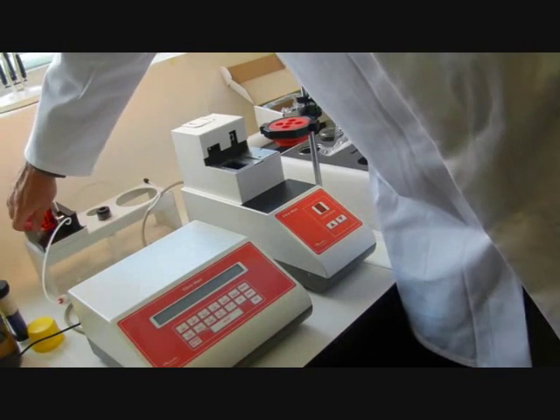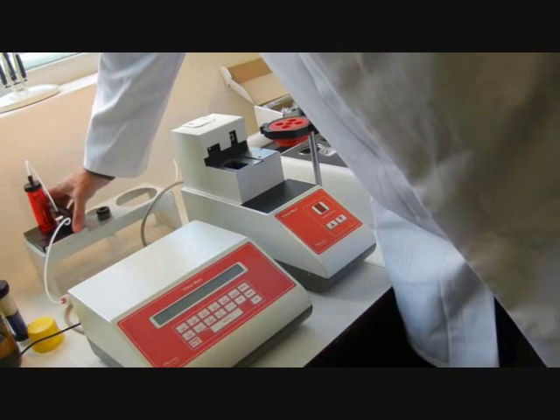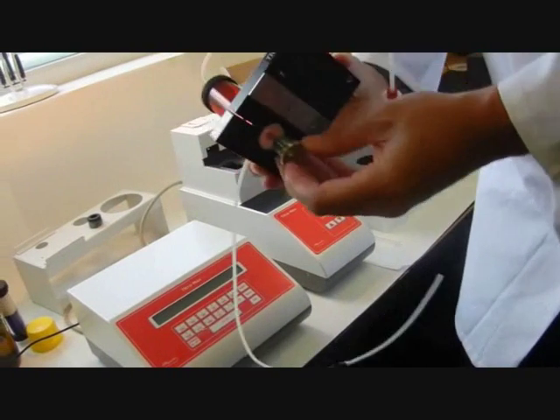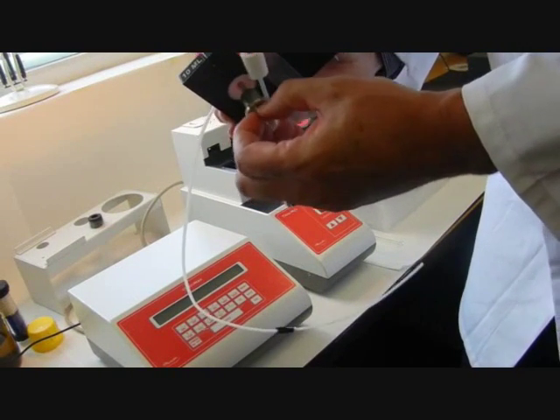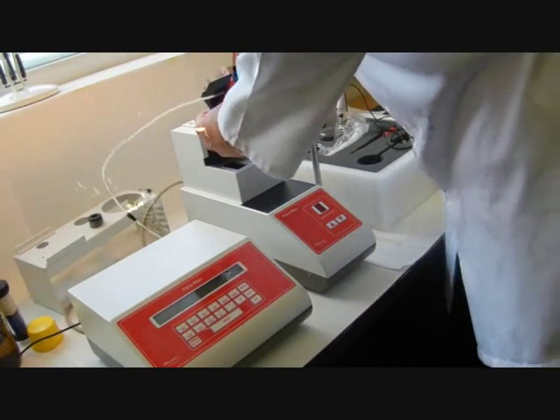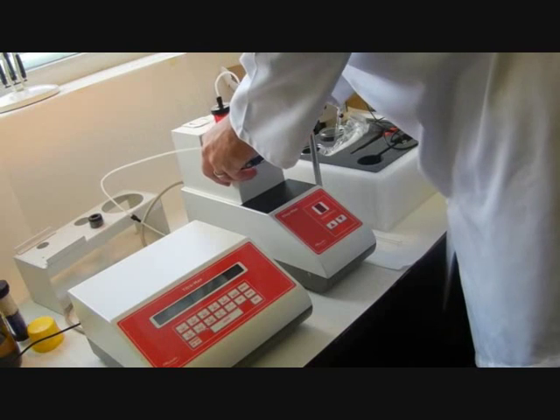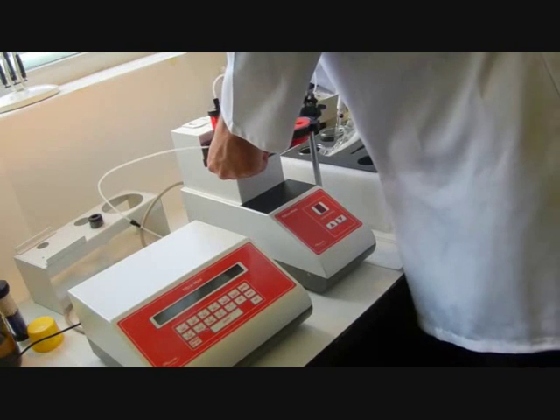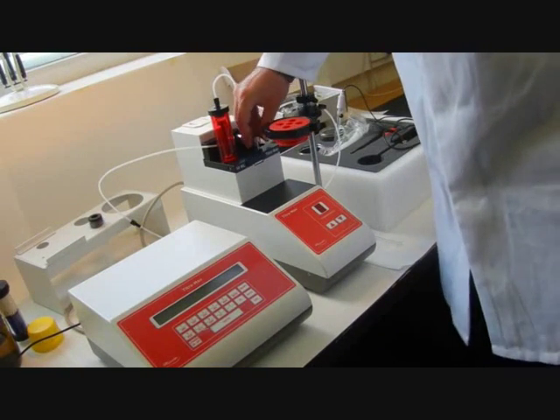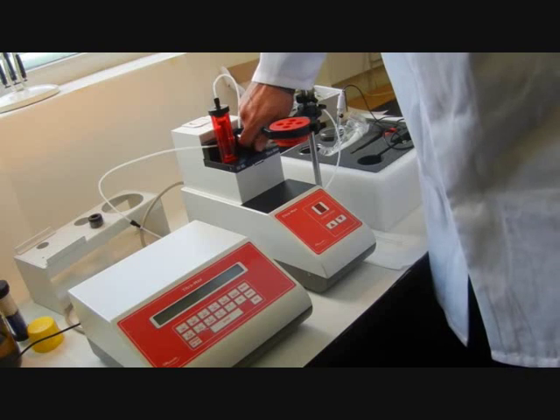We can now connect the burette unit. Unscrew the retaining screw in the stand, take out the burette. At the bottom of the burette the plunger has a groove which needs to be aligned to the groove inside the burette unit. You can see there. It's very important that this is aligned. The whole burette unit is pushed down firmly and slotted in. Now take the retaining screw and screw that in. When that's in place the control unit will recognize that the burette has been fitted.